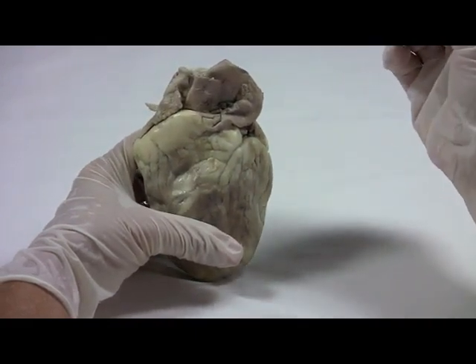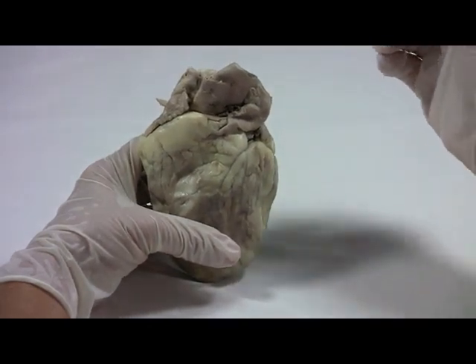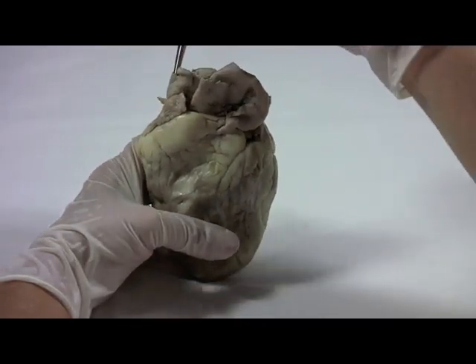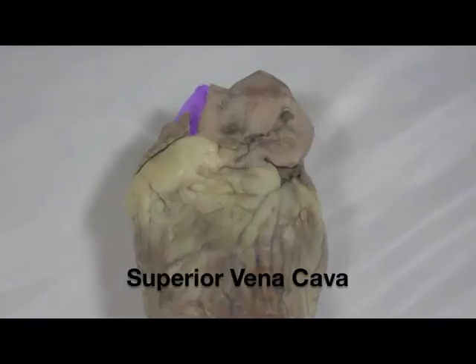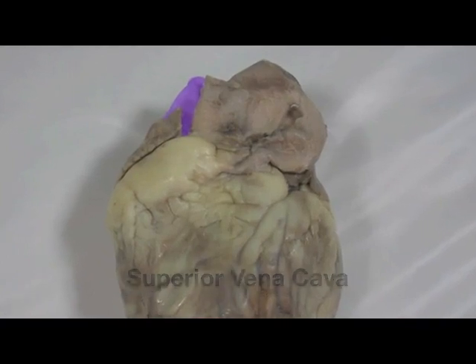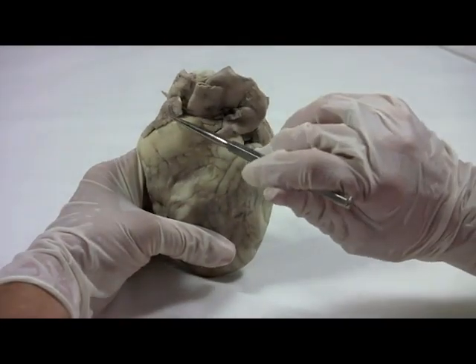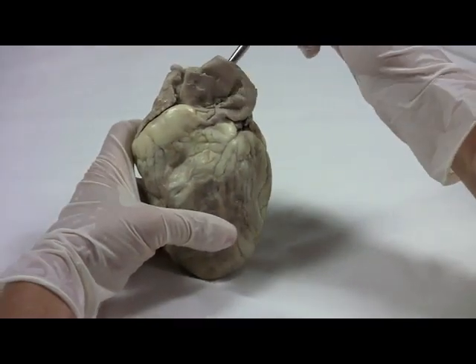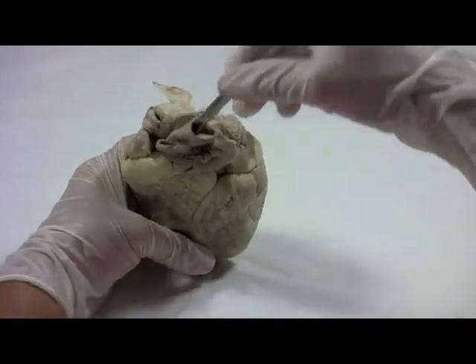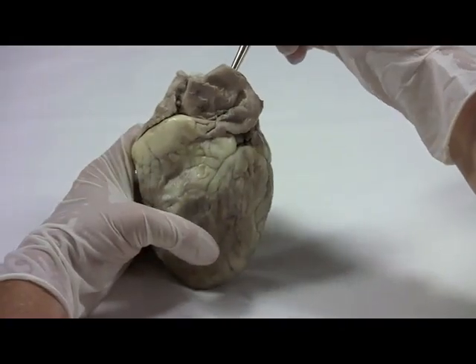Let's take a look at the vessels on the superior surface of the heart. This is the superior vena cava. The superior vena cava brings deoxygenated blood from the body into the right atrium. This large vessel on the top of the heart is the aorta. The aorta conveys oxygenated blood from the left ventricle to the body.